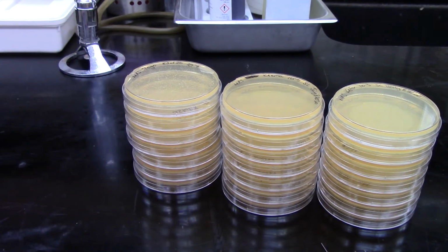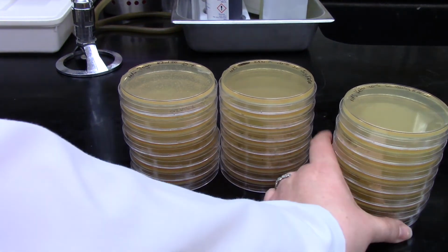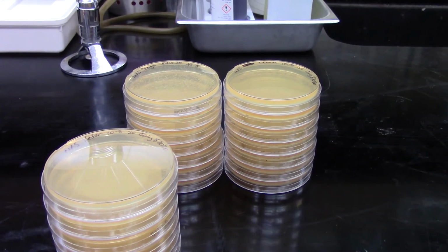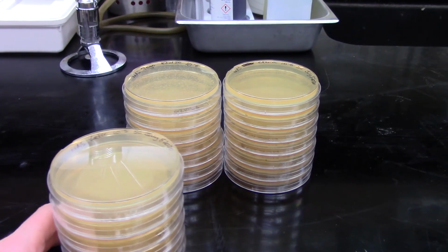And when I took a look at that, I did notice that we had actually passed the best before date. So it's quite possible that there were still some active bacteria, but just not enough to show up on that 10 to the minus 5 dilution.